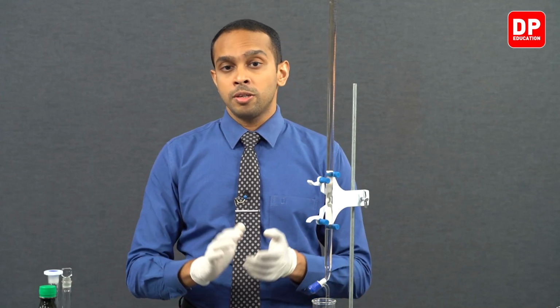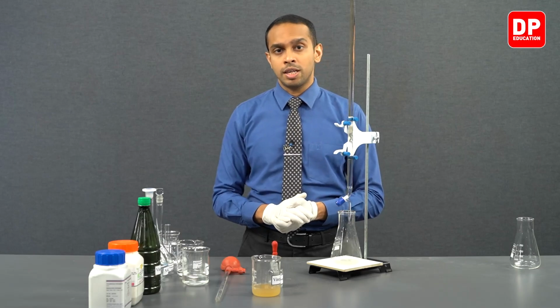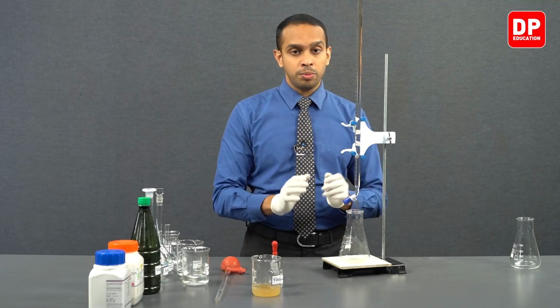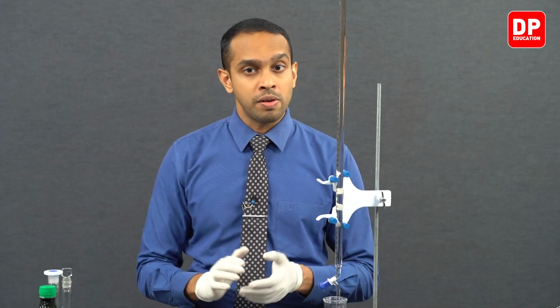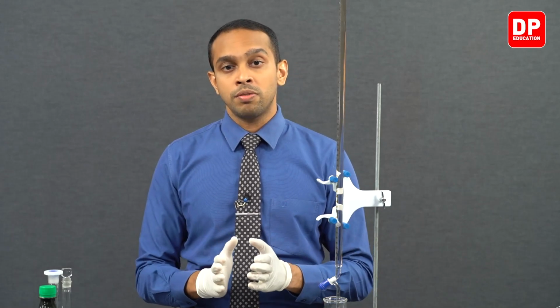Now, students, we have a burette that is freshly filled with sodium hydroxide solution we prepared earlier. It is filled all the way up to our 0 line here on the burette. So, all that is left for us to do is now start our titration. We know we obtained our very first burette reading at 21.4 when we were carrying out the first titration. So, we can be somewhat certain that in the second titration also, we will obtain our reading around 21 cubic centimeters or maybe close to 20 cubic centimeters.